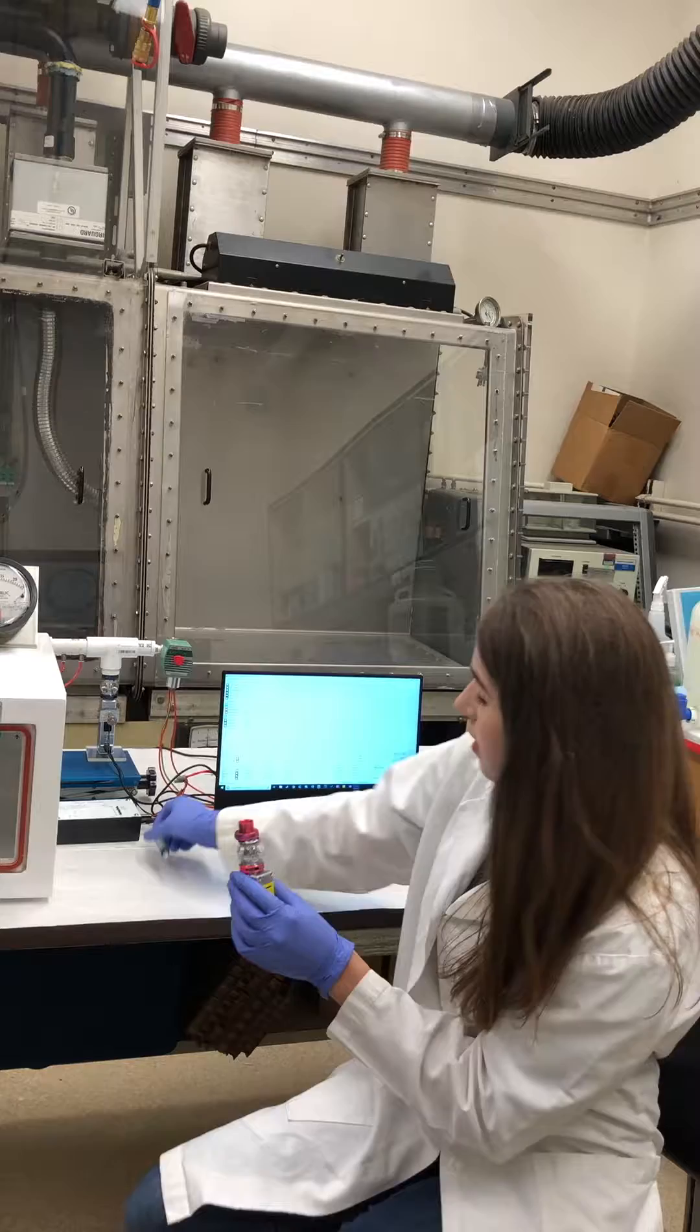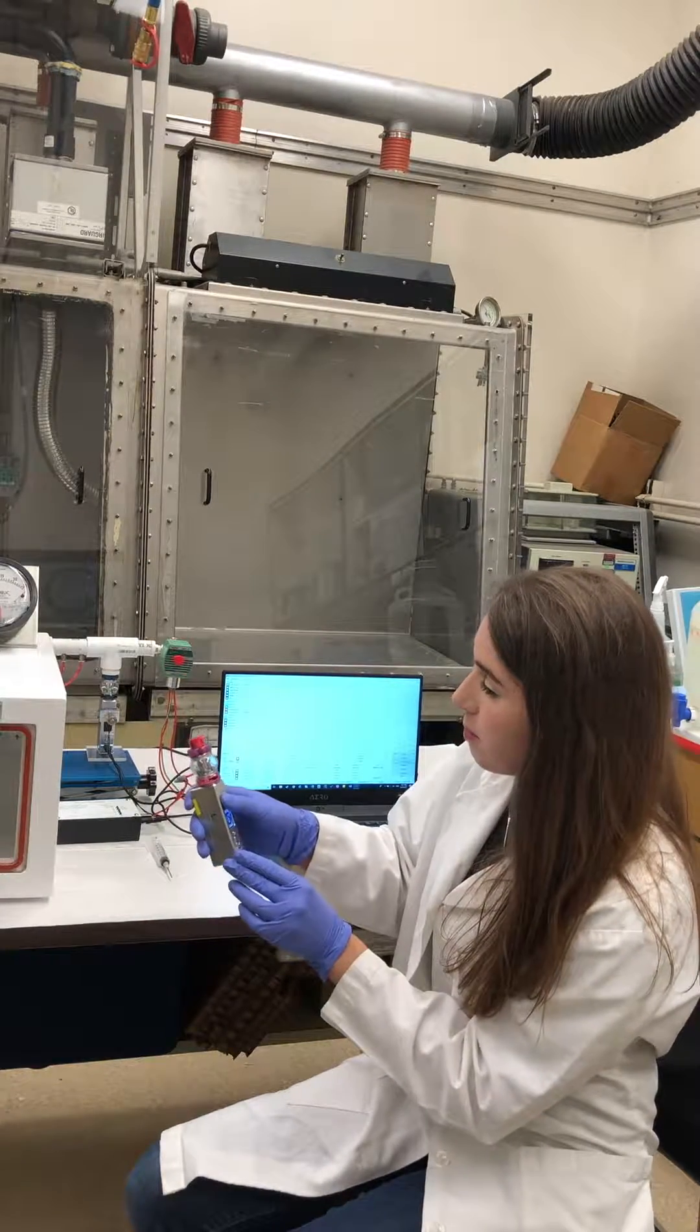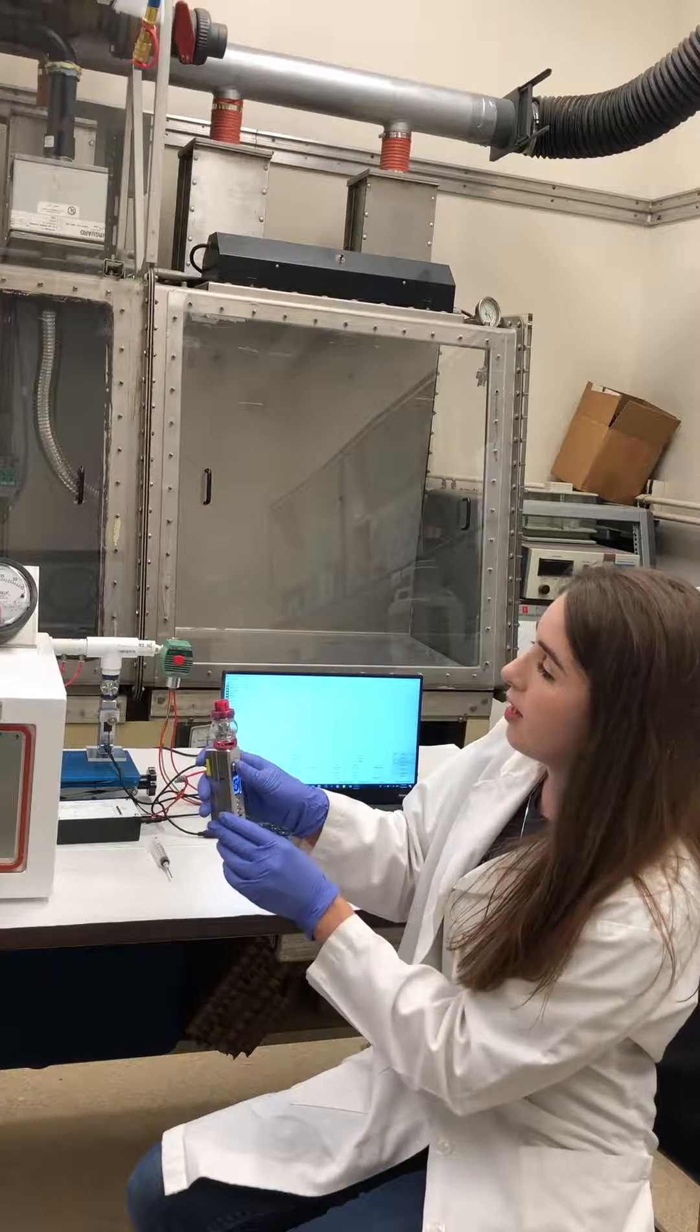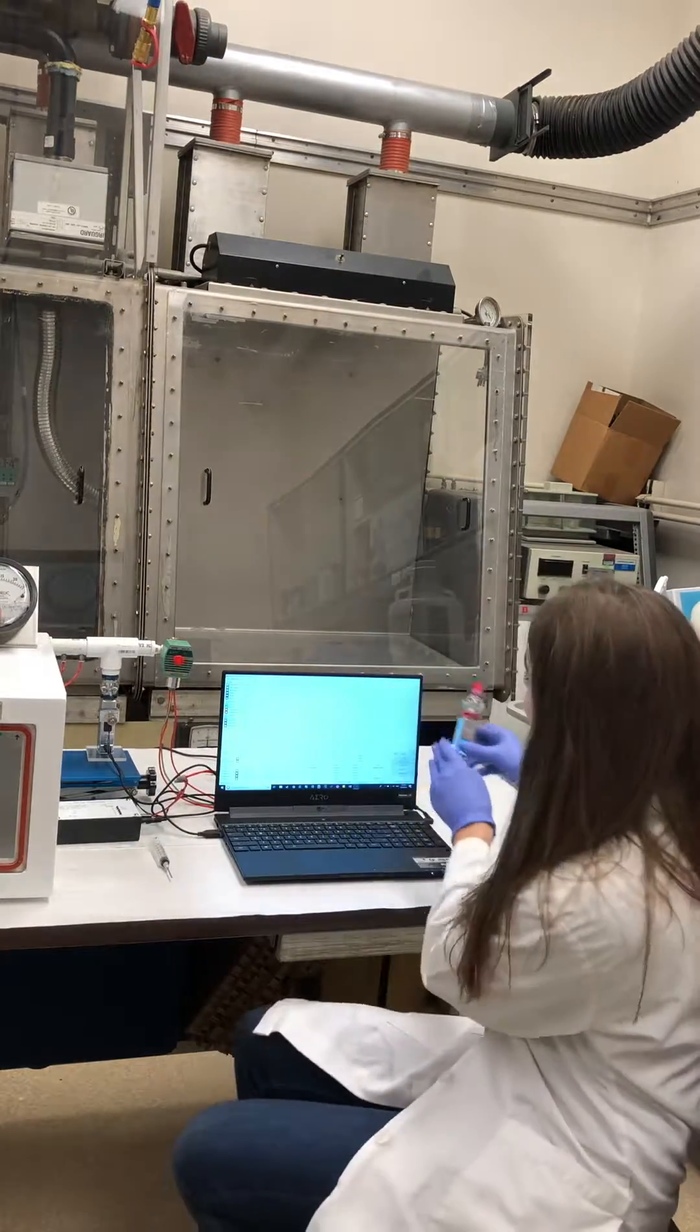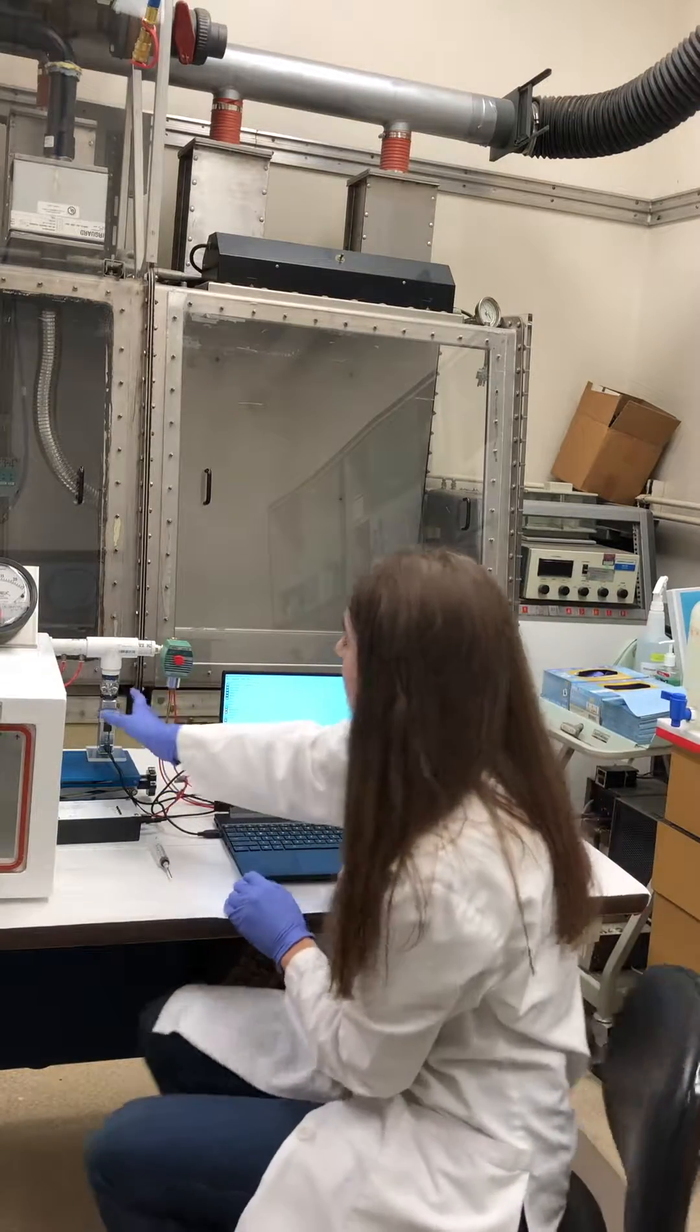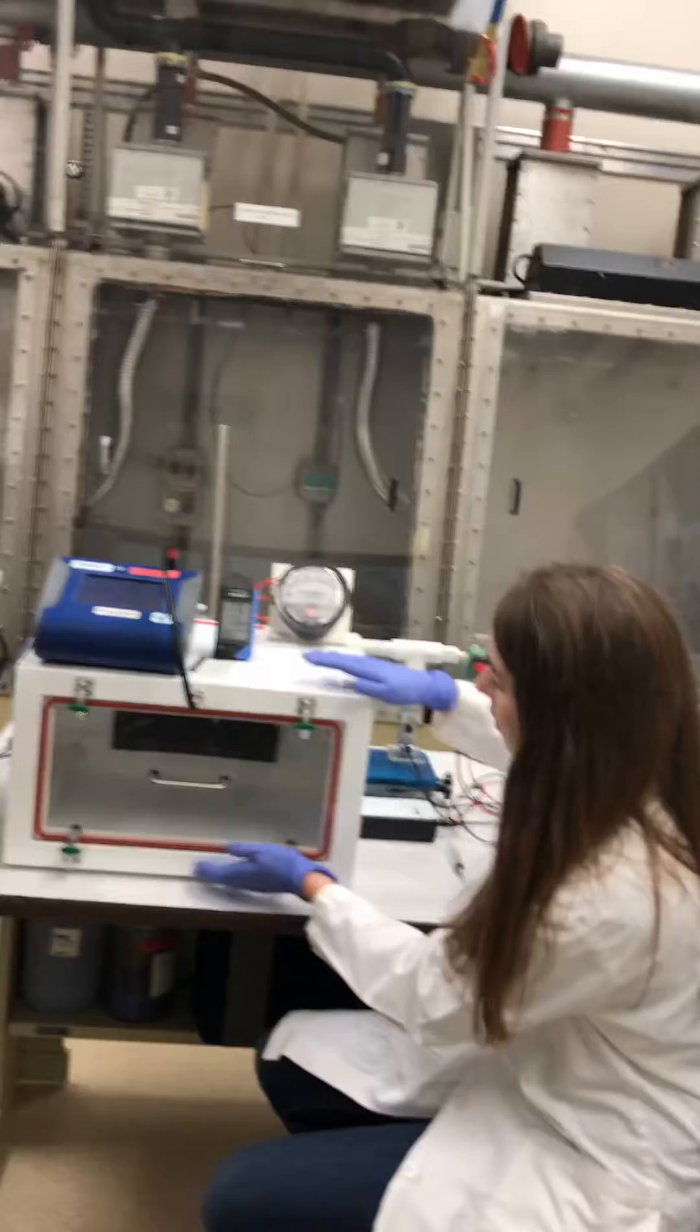And that then, closed up, can puff on the device. And if I was a user, I would inhale. But we have a device here already connected to the tubing that then goes to this exposure chamber.